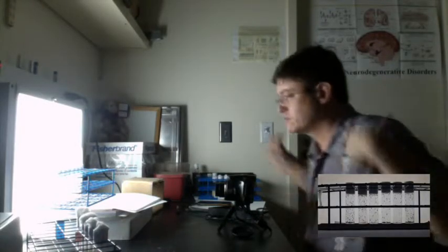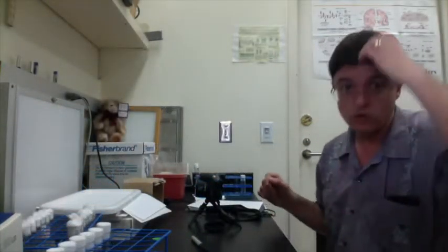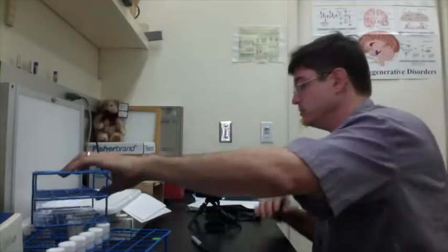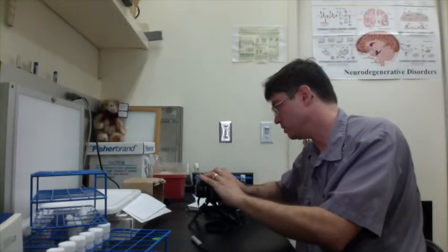So this has been going for 5 minutes, 20 seconds. I think it's probably pretty good. So I'm going to shut it down. And that's it. That's the end of the assay. Okay, so the next thing is, what do we do with this information? Well, this camera has got an SD card in it. And I'm going to pull that out. And we will insert this into my computer.